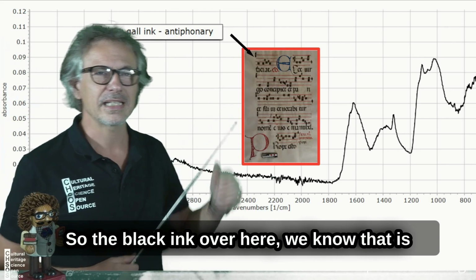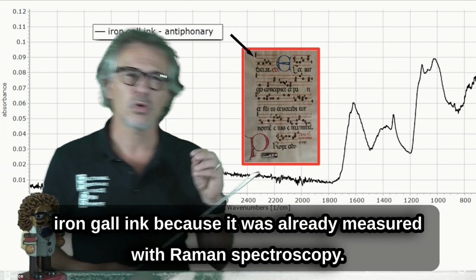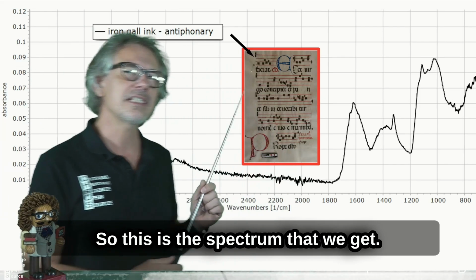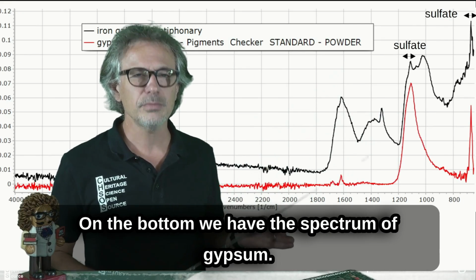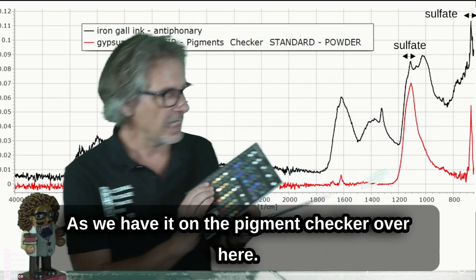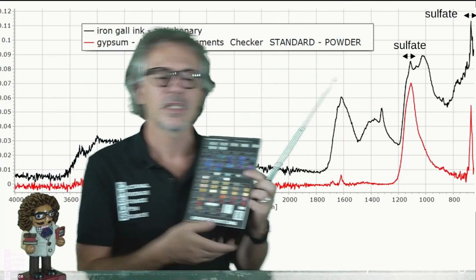Okay, now we move into the actual measurement of the iron gall ink. The black ink over here, we know it is iron gall ink because it was already measured with Raman spectroscopy. So this is the spectrum that we get. Let's interpret it. On the bottom, we have the spectrum of gypsum as we have it on the pigment checker over here.